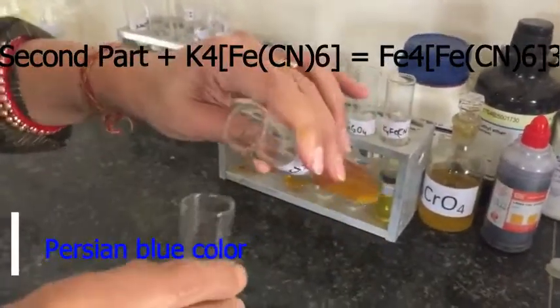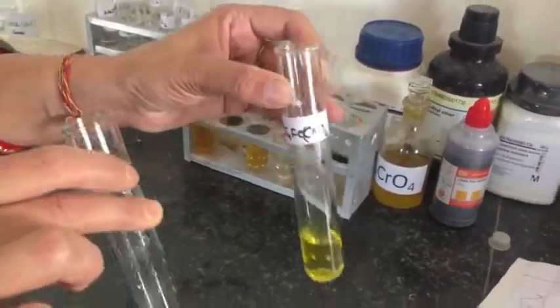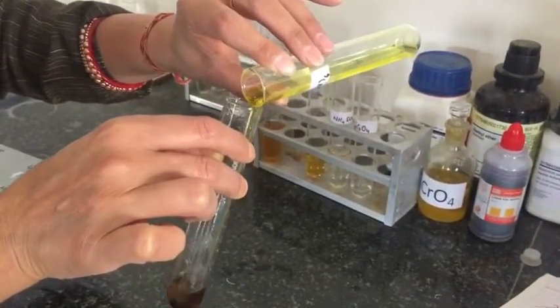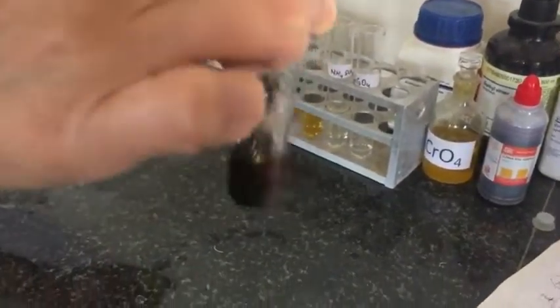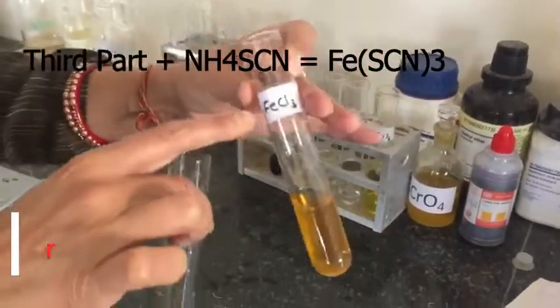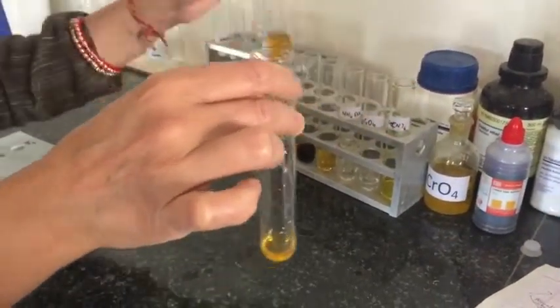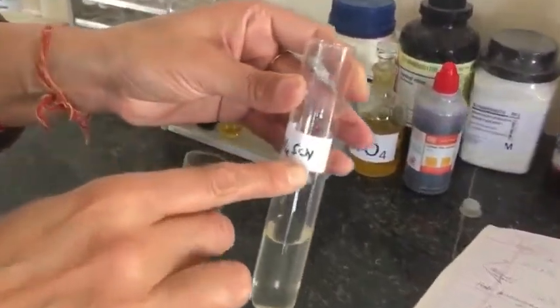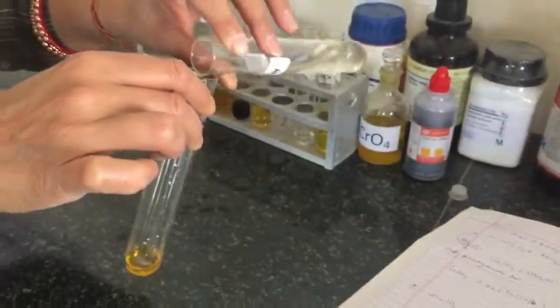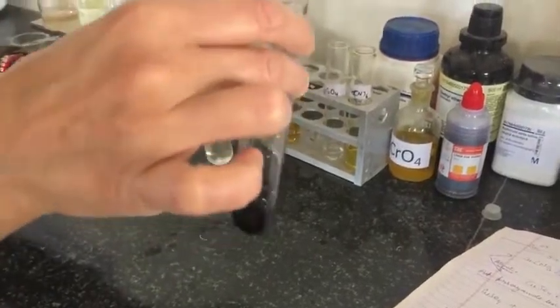To the second part, I have added potassium ferrocyanide and it gives a Prussian blue colour. To the third part, I have added ammonium thiocyanate, which gives a blood red colour of iron thiocyanate. Here you can see the blood red colour.